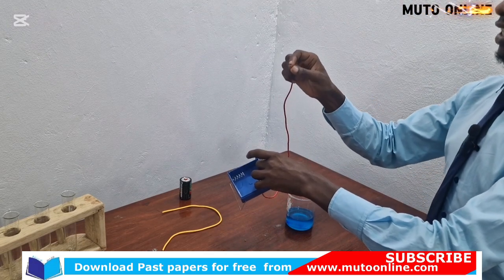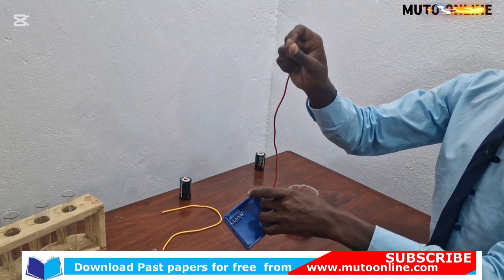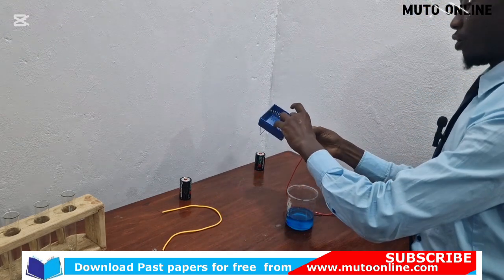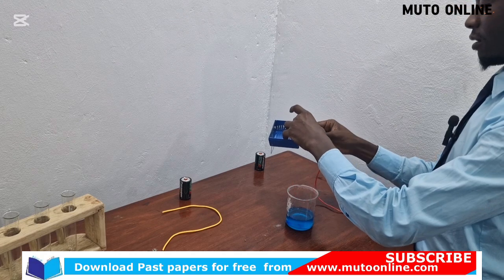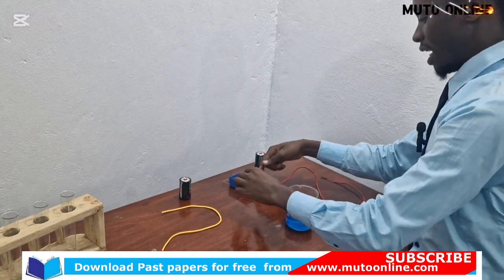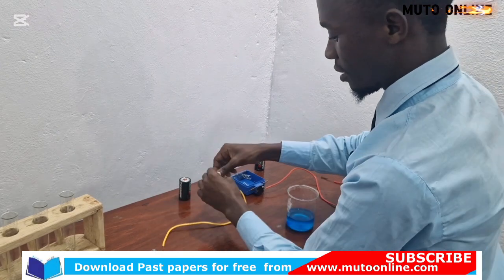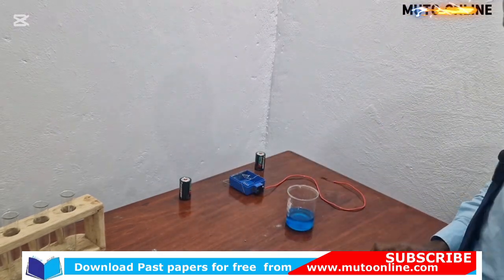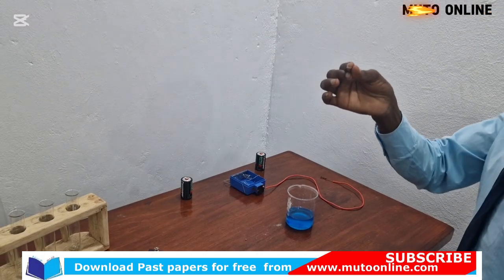So you shall notice a decrease in the mass, the size of this part of it. I'm going to use this copper as my anode, and then I'll make sure that this one I want to coat with copper is my cathode.